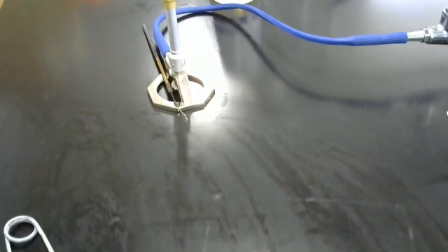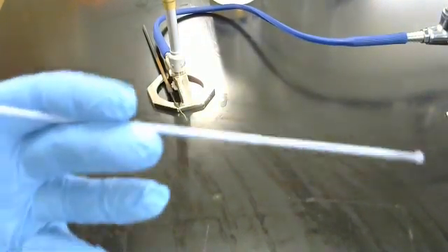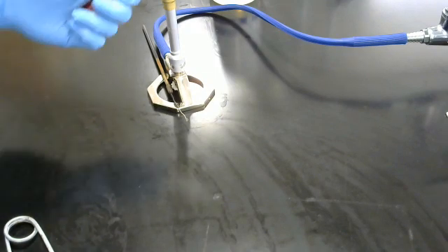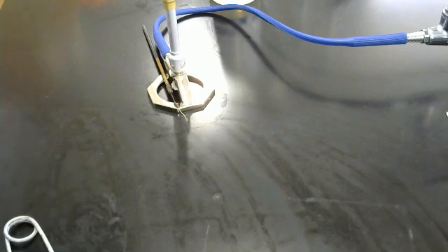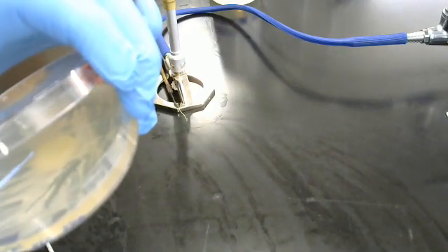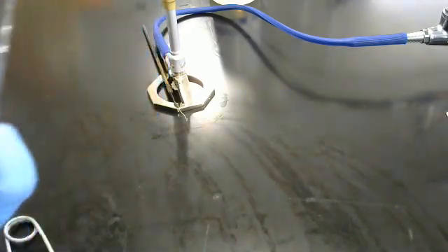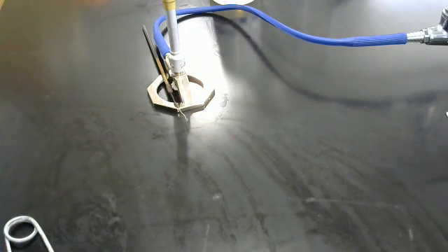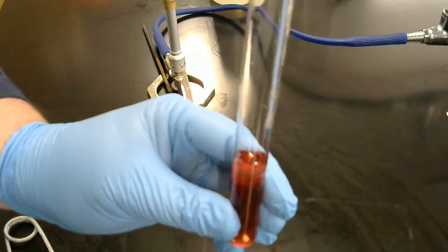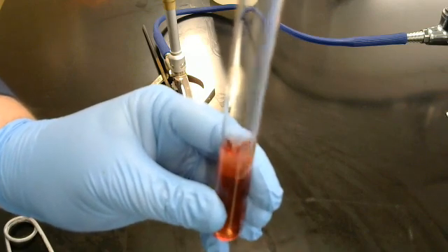Next thing we are going to take a look at. Disposable tool. Same thing. One, two, three. Grab some bacteria. Down the middle. And a bit of a shake.